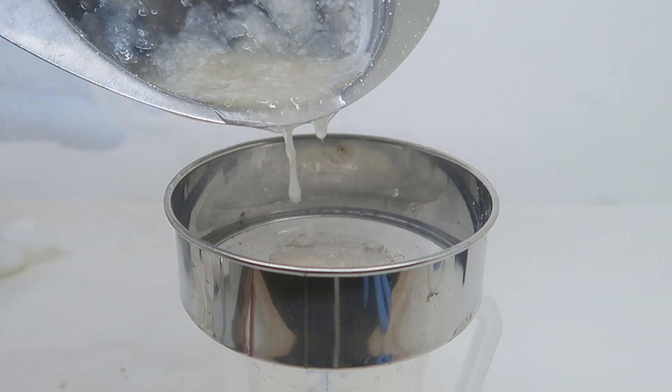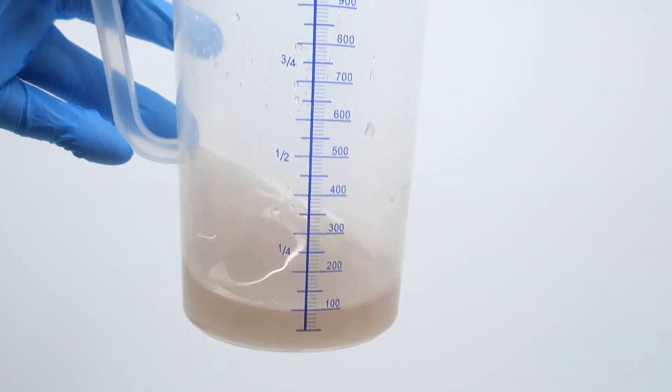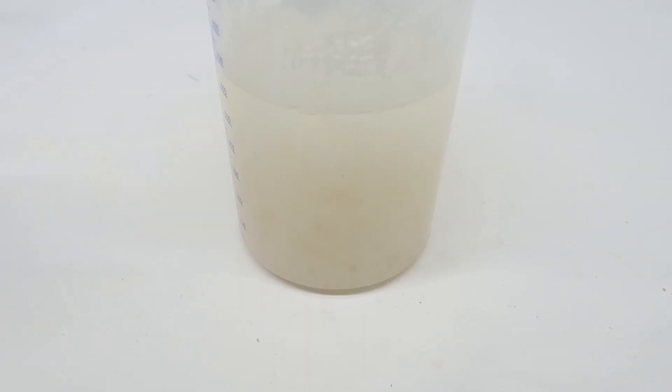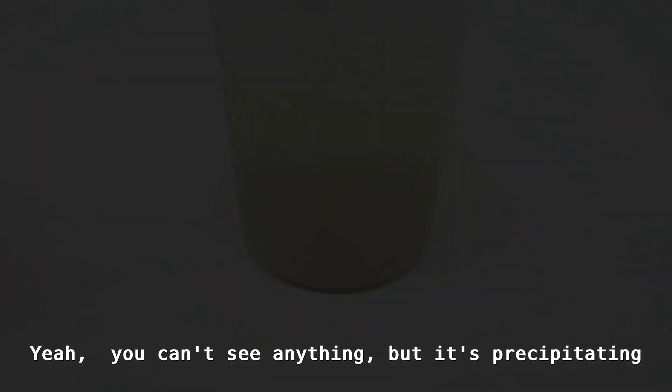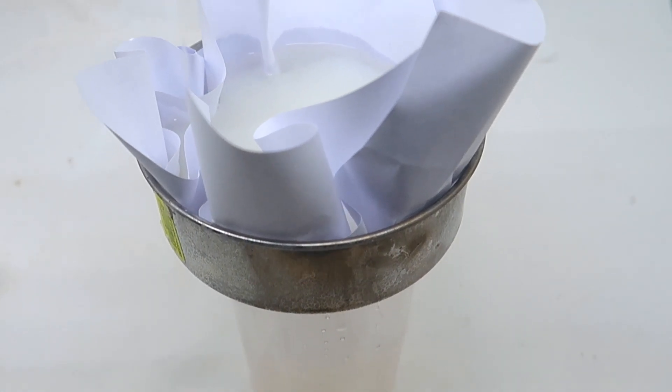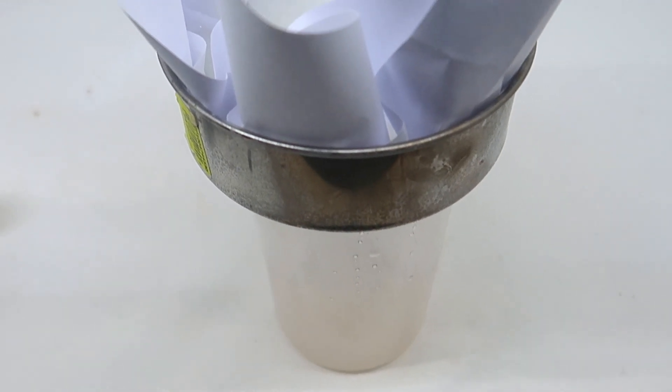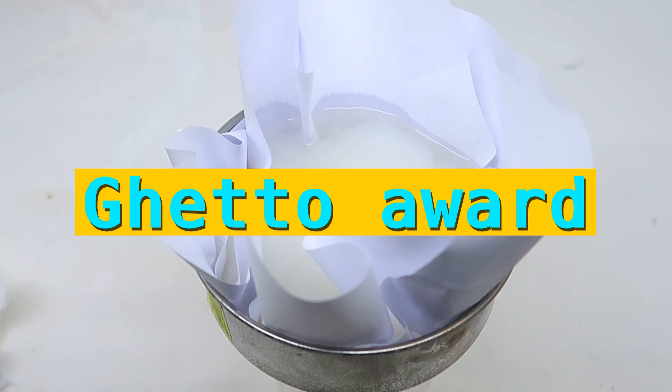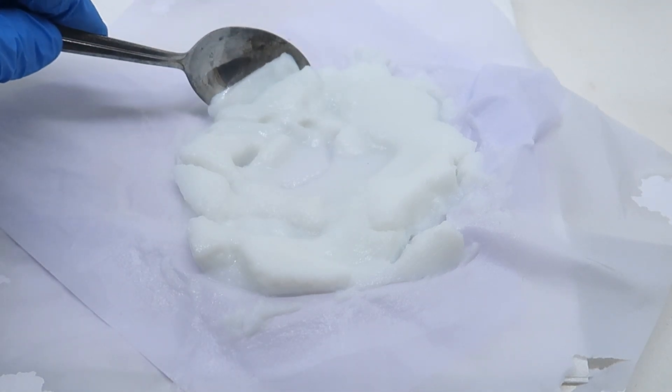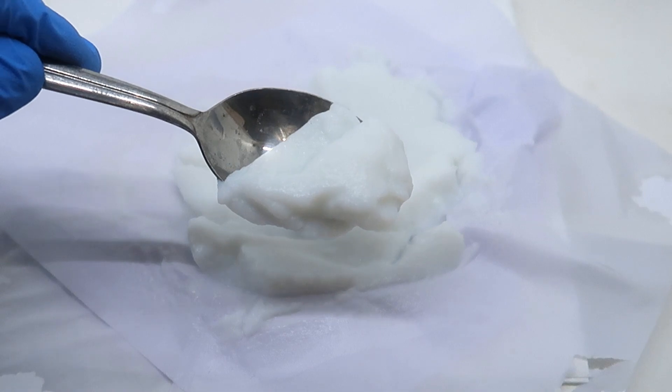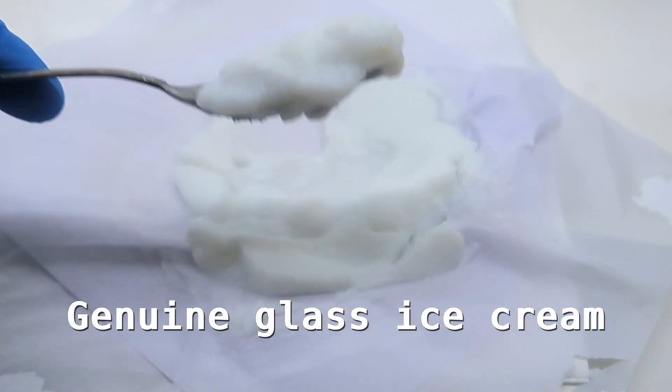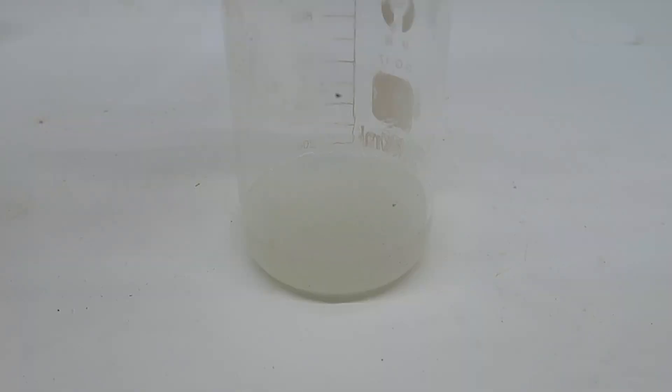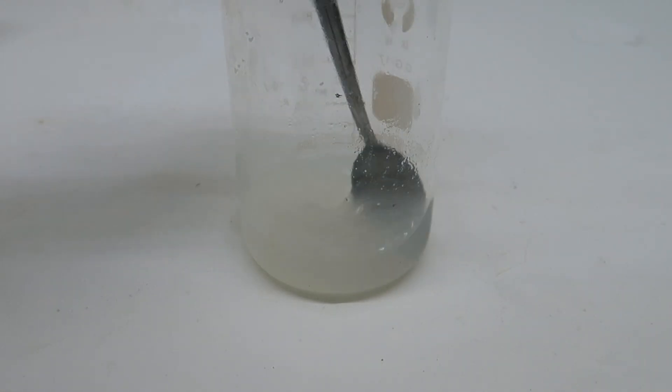And what we now have is this thick sodium silicate solution. I decided to clean it up once more, only this time I would precipitate it first and then filter it. Interestingly, the coffee filters were not fine enough and everything would just go through. Therefore, I improvised a very ghetto, yet very effective solution, which was to use printer's paper. And it worked wonders. Once that was done, I was left with a pure thick white ice cream-like glass gel. Now that it's clean, I just scooped it up and put it in a beaker, and yet again added some sodium hydroxide to it to dissolve it.